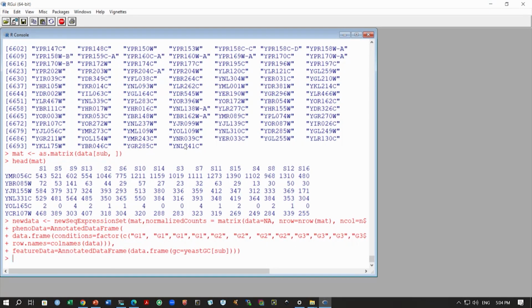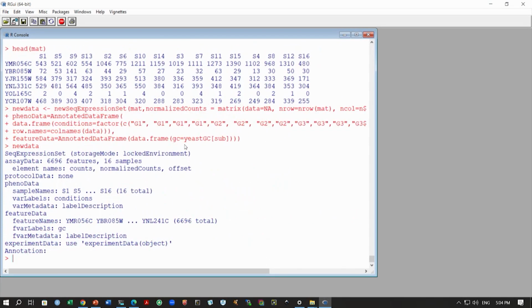Okay. It has generated this new data now. We can probably type it, and it will show you, right, this is the seq expression set class of data. Okay. This is what we wanted, right. This is what we want to create before we can run this within lane normalization method. And again you have some statistics about the data, what are these assay data, how many samples, sample names, the feature names, these are all given here. Okay. So, what I wanted to show you is that we are running this according to the manual, right.